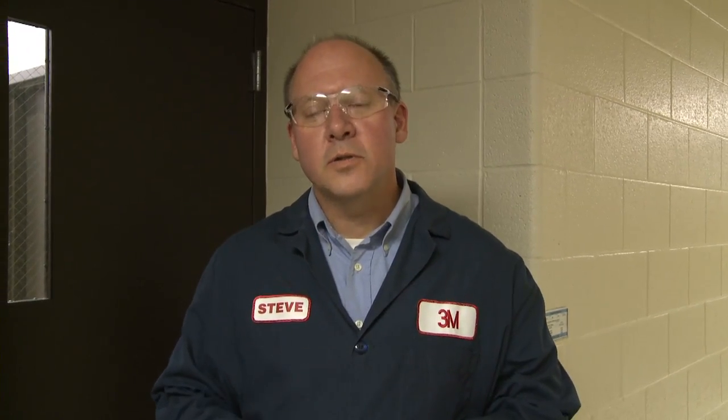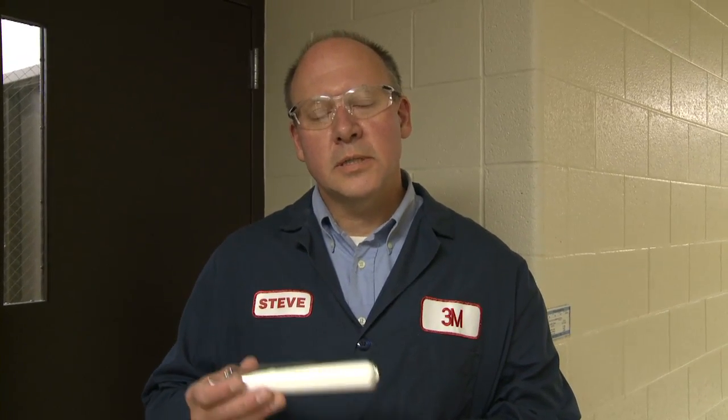You might ask, what are these useful for? These are low in density, between 0.1 and 0.6 grams per cc in density. So you can put these into plastic resin systems and make very lightweight composite systems. Let me show you how we do that in my laboratory.